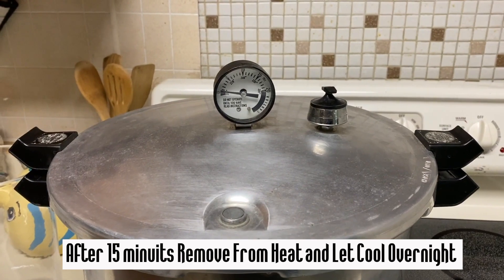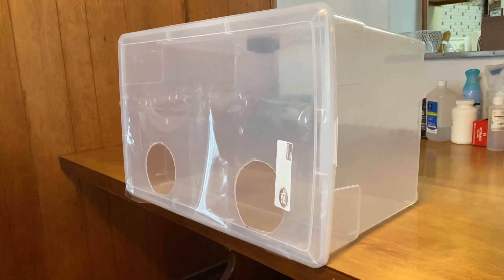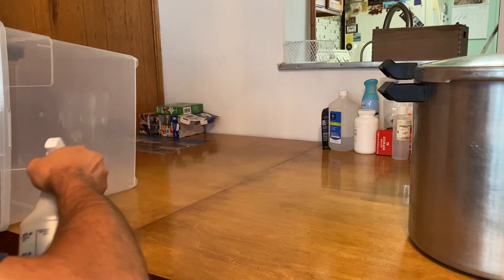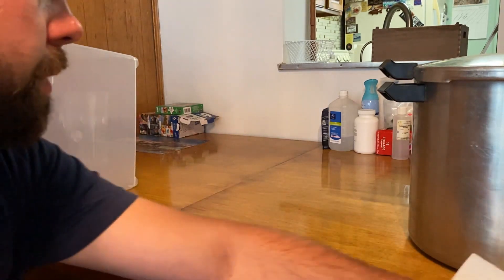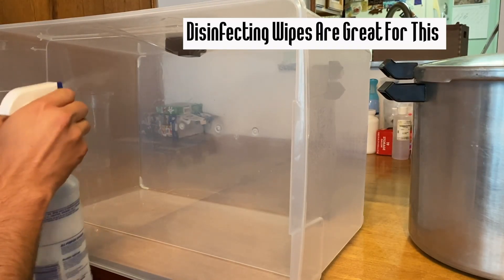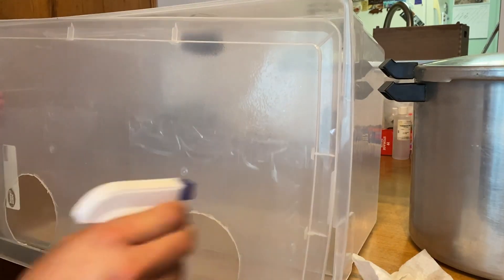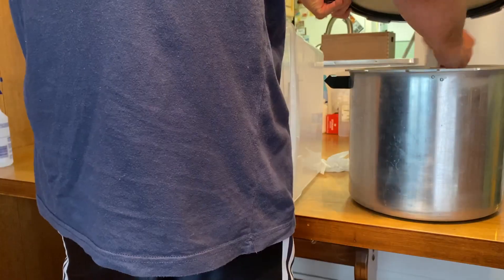I let the pressure cooker cool down for a full day until I do my tissue culturing. The still air box is just a big Tupperware container with two dremeled holes to fit my hands through, with ziploc bags taped to the front. The name of the game here is sterilization — I spray down the table and my whole work area with rubbing alcohol and wipe it down. Next I spray inside of the still air box using 90% alcohol — 70% works too — and wipe down the inside and also the inside of the lid.